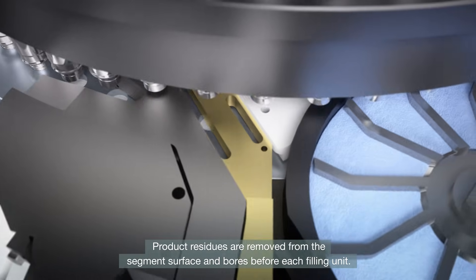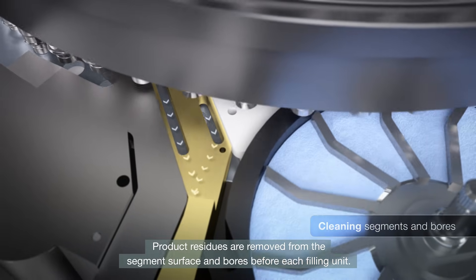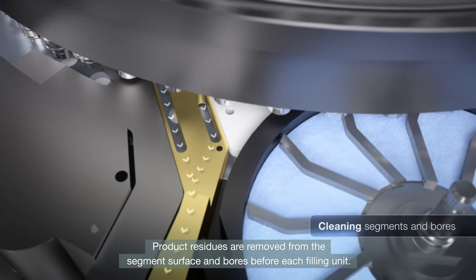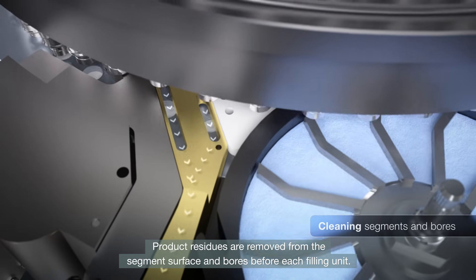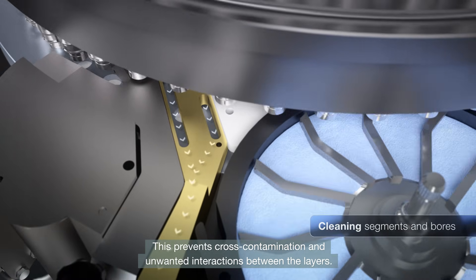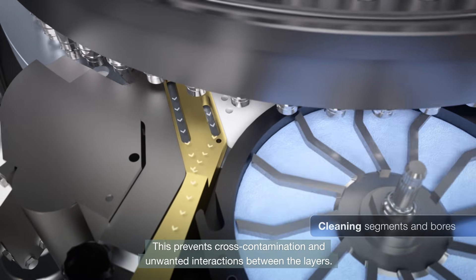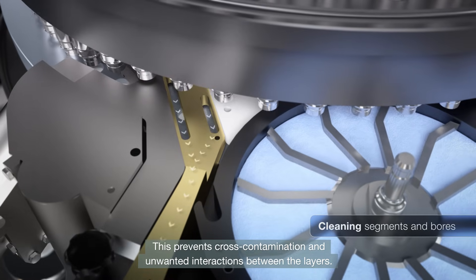Product residues are removed from the segment surface and bores before each filling unit. This prevents cross-contamination and unwanted interactions between the layers.